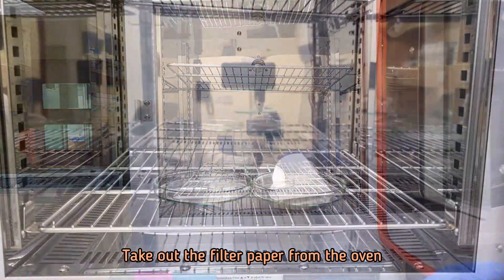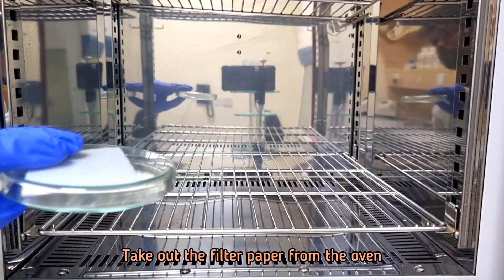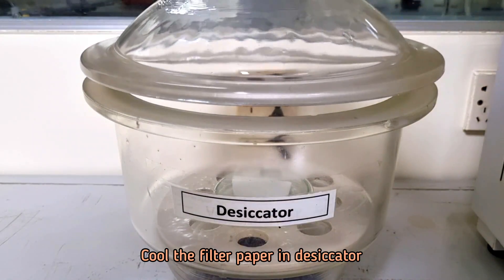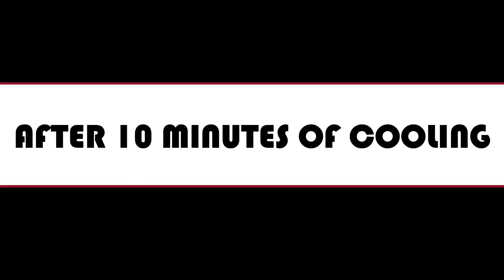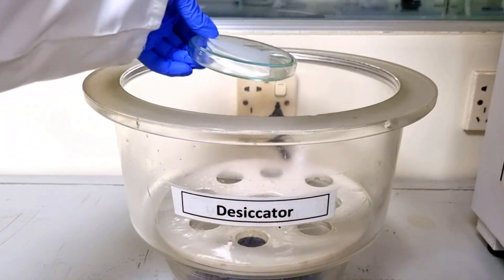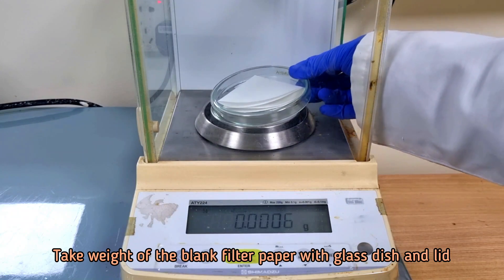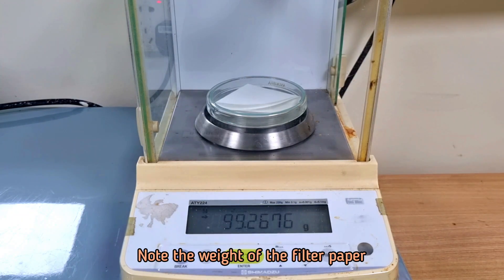Take out the filter paper from the oven and cool it in a desiccator. Then take the weight of the blank filter paper with glass dish and lid, and note the weight of the filter paper.